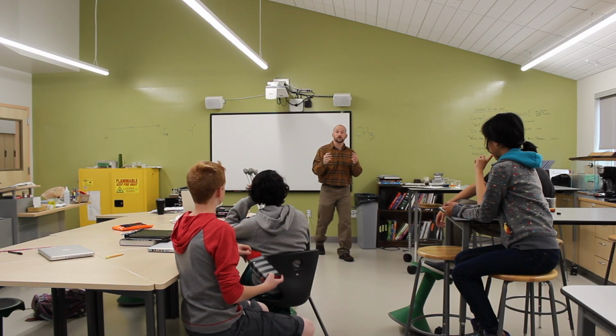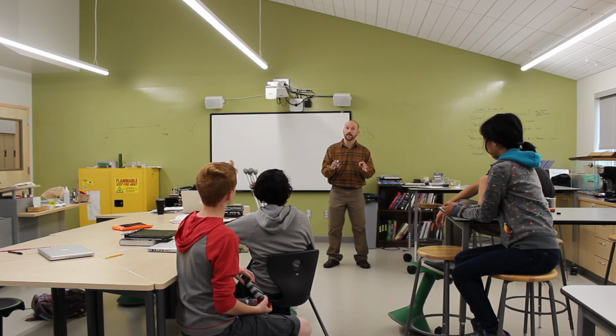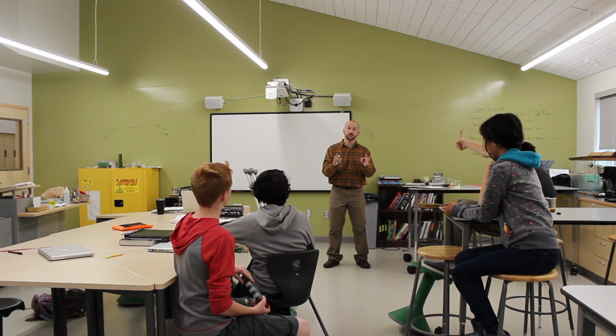All right, guys. Now, I just want to stress that you all need to be listening to me very carefully today because this is a dangerous lab. Yes, please, sir. Please have your attention.